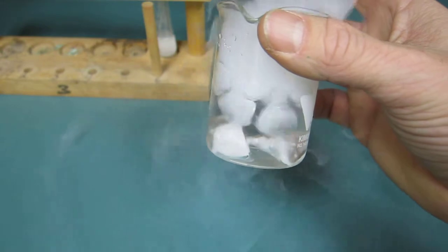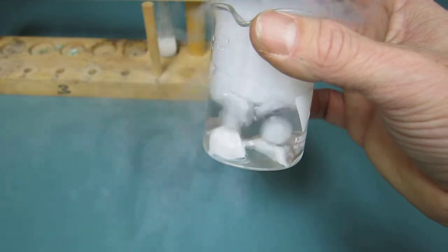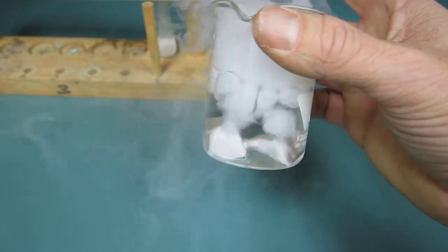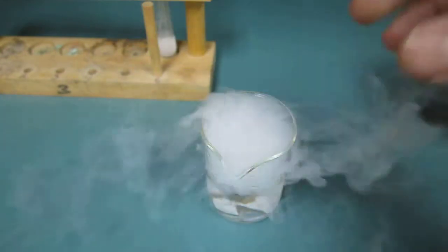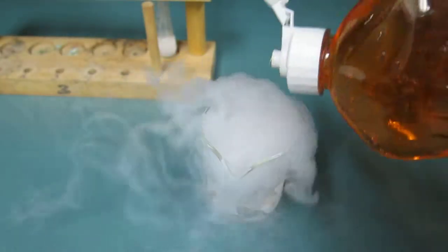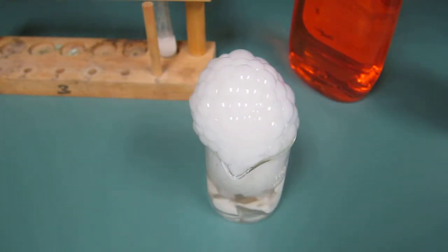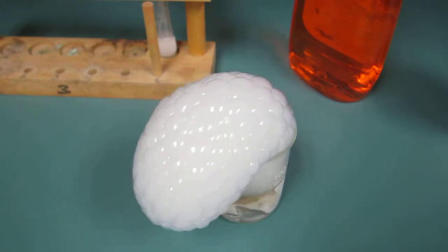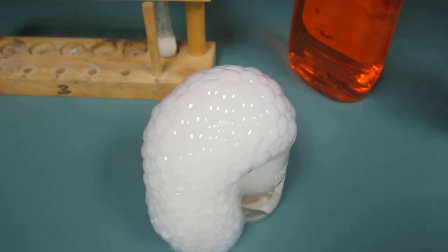Those bubbles are carbon dioxide, right? Because it's sublimating, going straight to the gas. So they're carbon dioxide bubbles. And just for fun, a little soap. That's going to be a fun mess.